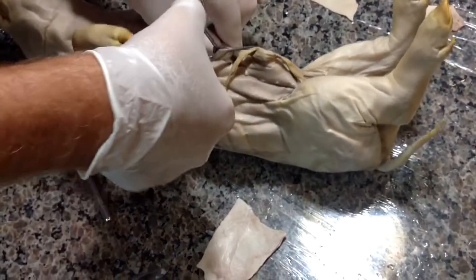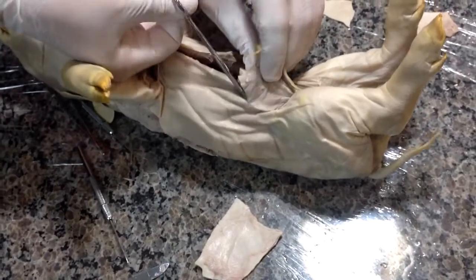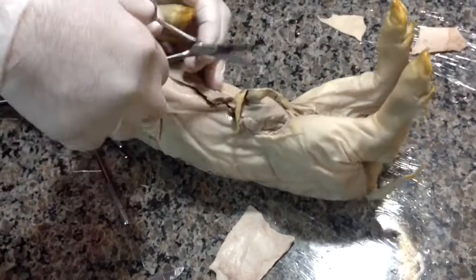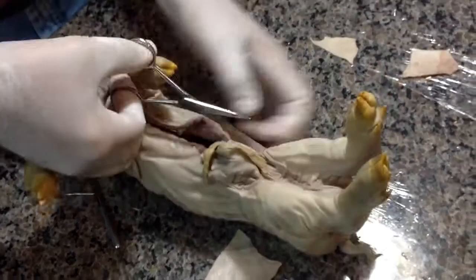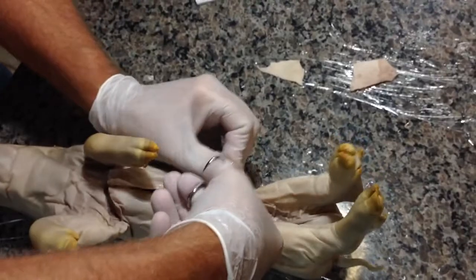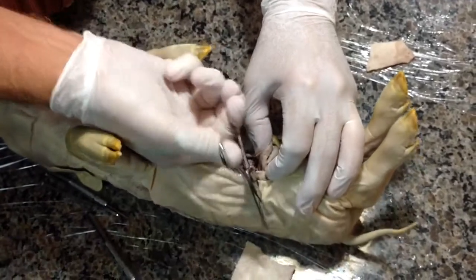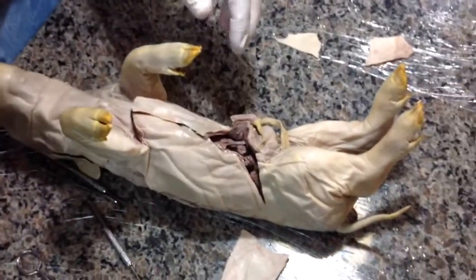There we go. Now we're going to cut around the umbilical cord, because we've got to preserve some area that we want to talk about. And then we're going to cut down on the other side of the legs. So we have actually made a really classic incision. That's slightly true for humans too, and I'll show you why.